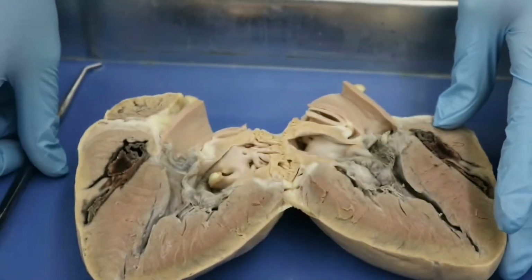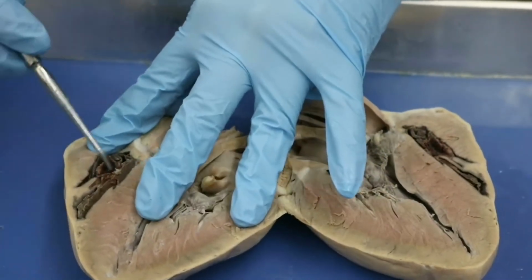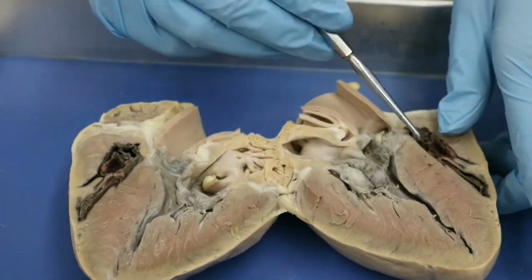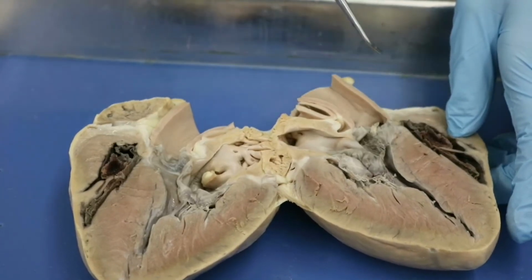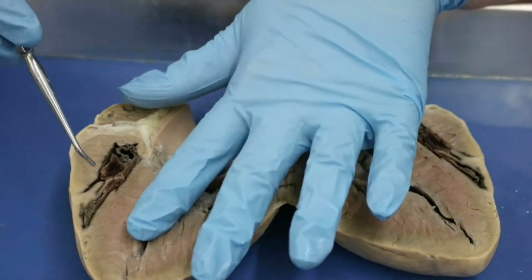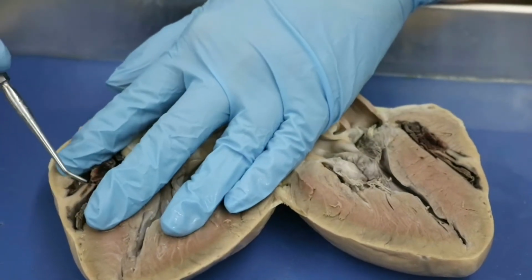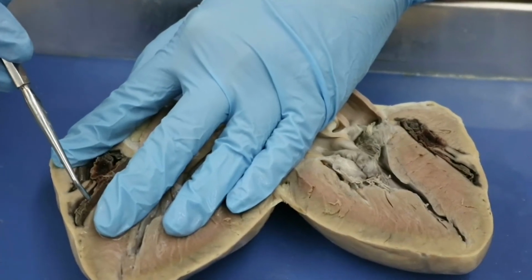Also, you'll notice that there's really not a lot of space in our right heart. And that is because this right heart has a blood clot. So there is a significant blood clot on the right side of the heart. I don't know what happened to this pig to cause that to happen, but you can see that most of the space of the right heart has been taken up by this blood clot. However, you can notice here, if we kind of move things aside, we still have a space here where you can see the difference between the right atrium and the right ventricle, okay?